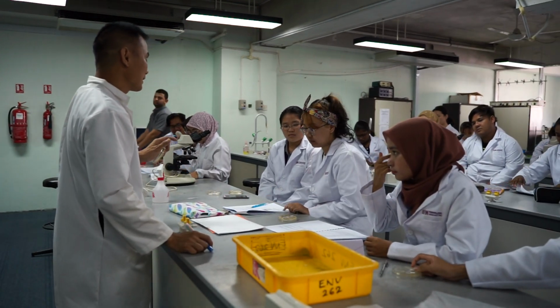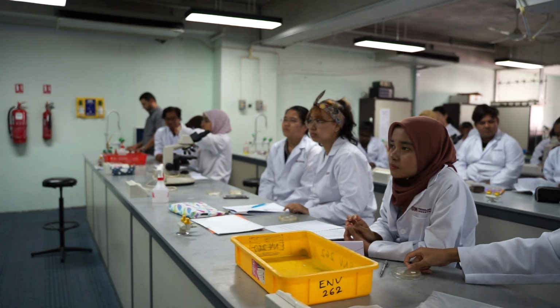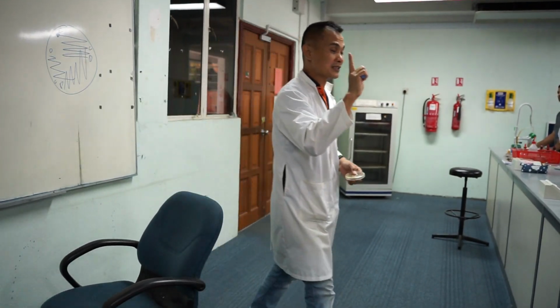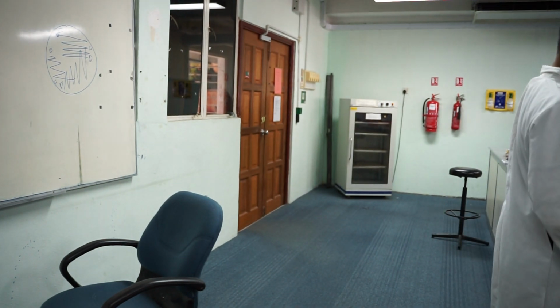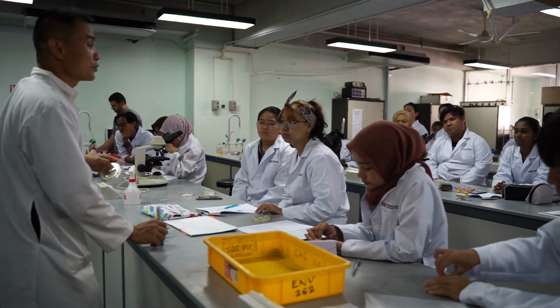The second part is assuming that you already have a single colony. You're going to grow from here. If you get a single colony at the end here, you can regrow from the single colony, and you're going to get one single colony all the time. It's the same species, so it's no longer a mixture. You can know what species they are inside your sample. Understand? Okay. And then you're going to do gram staining.